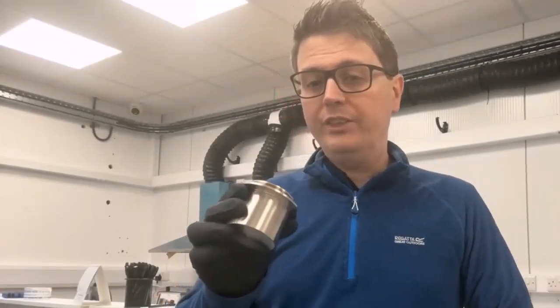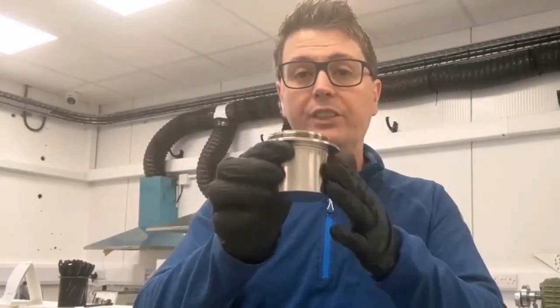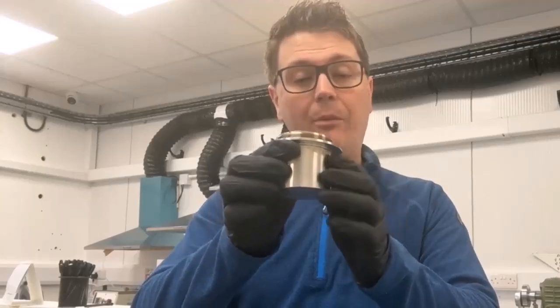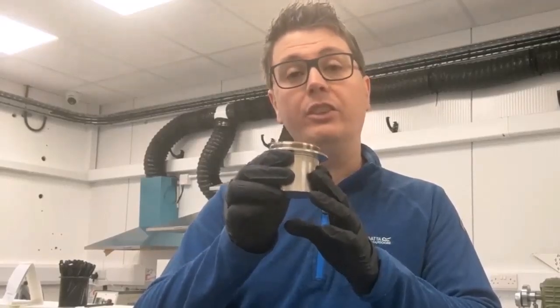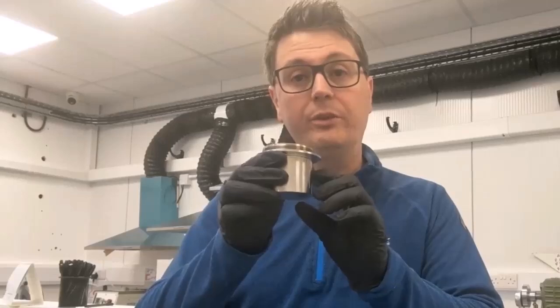I've got this container here right in front of me and we're going to fill it with oil and weigh it as we're doing it so we know how much oil we've put in. We'll take the weight of the container, then add the oil to know the combined weight, and then at the end of the test we'll weigh it again to see how much is lost. I'm just going to pour that out now.